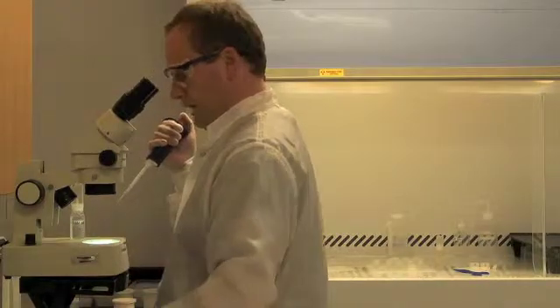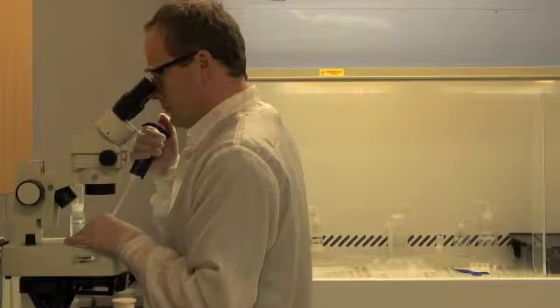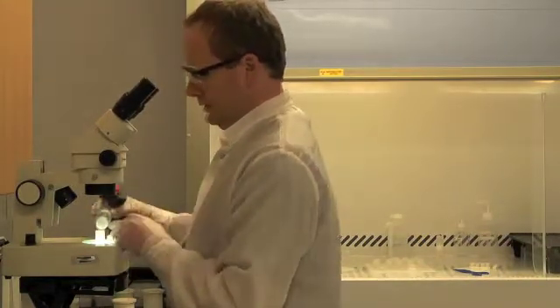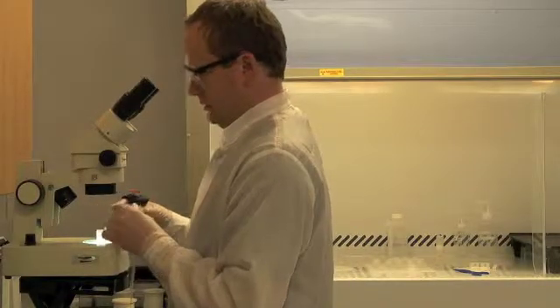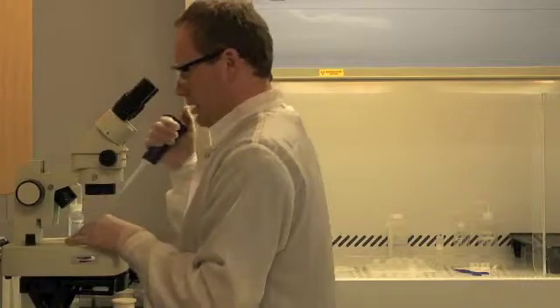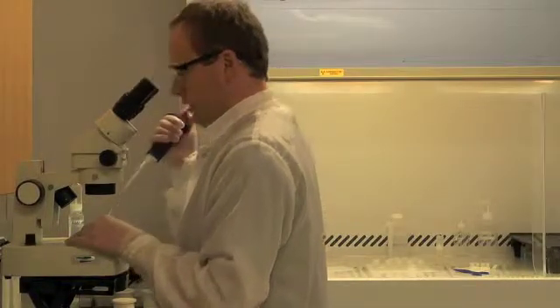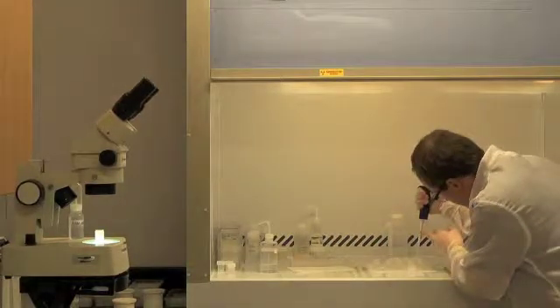I'm going to repeat that step. Add one last aliquot of nitric acid. And then pick up the grain, carry it to the hood, and pipette it into the microcapsule.